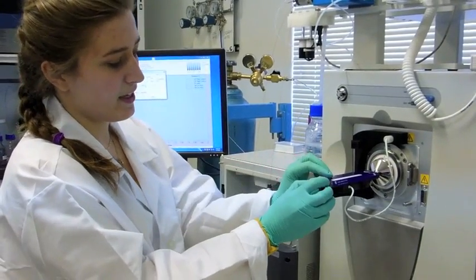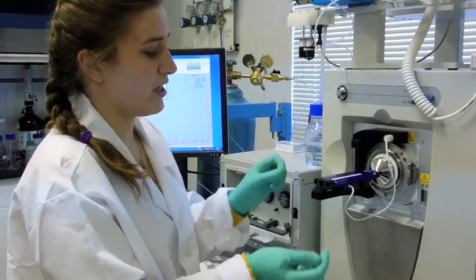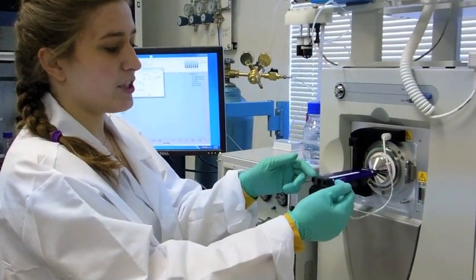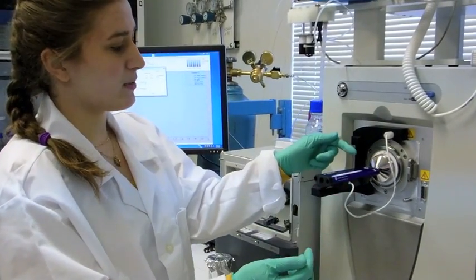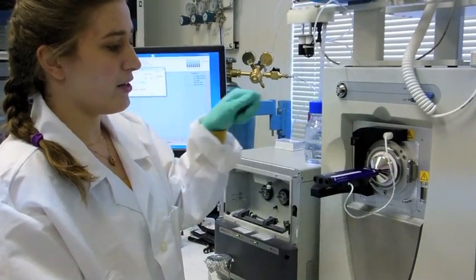You take your voltage key and insert it into the end of the Picochip. This engages the high voltage connection inside the chip, as well as exposed to the tip. Once you turn on the source, you're ready to go.